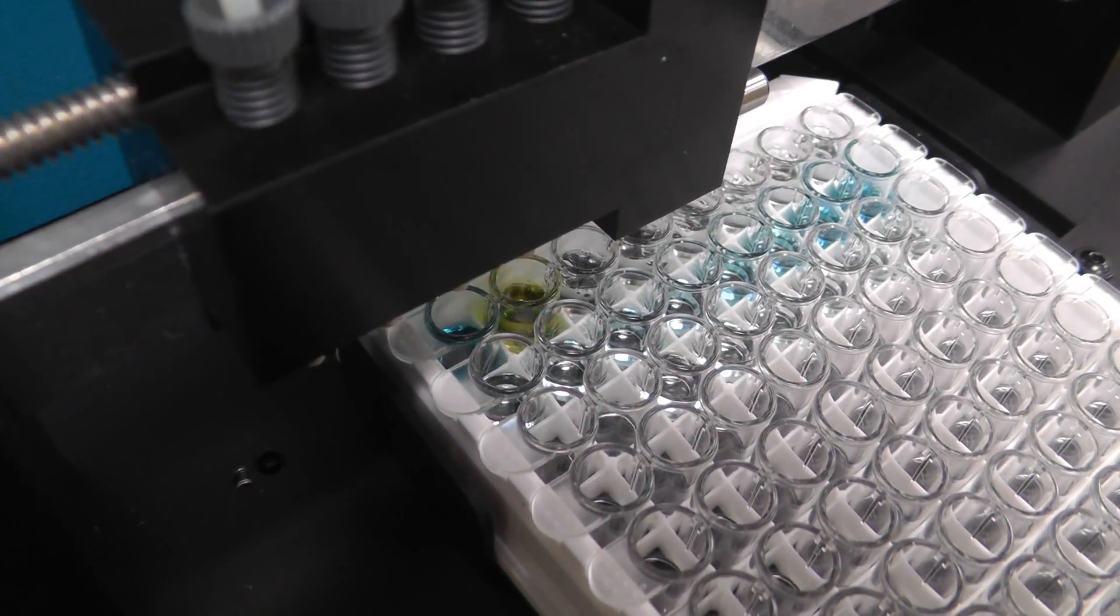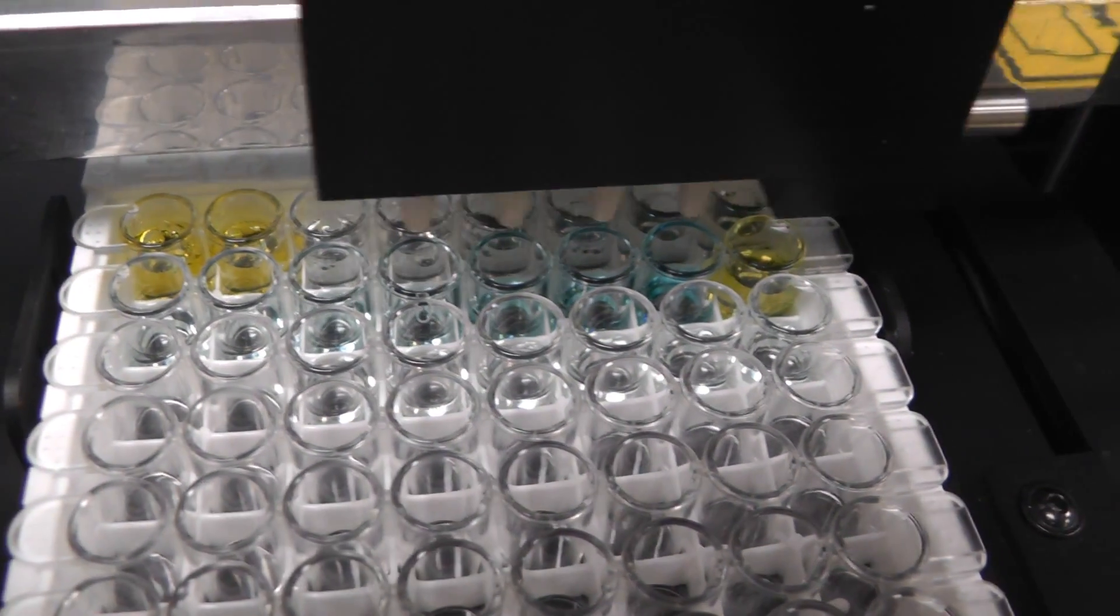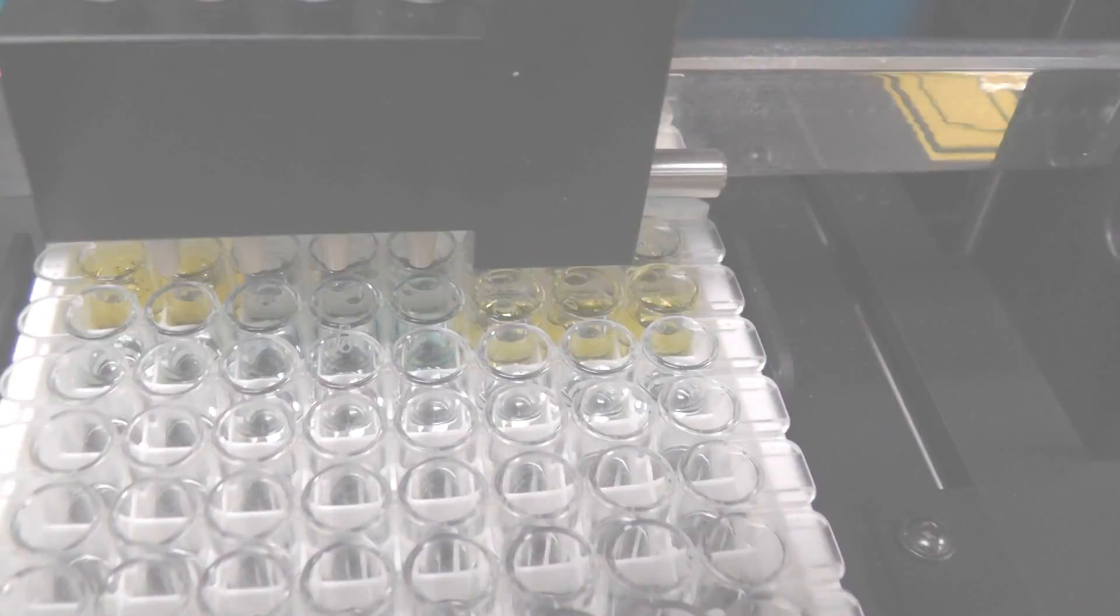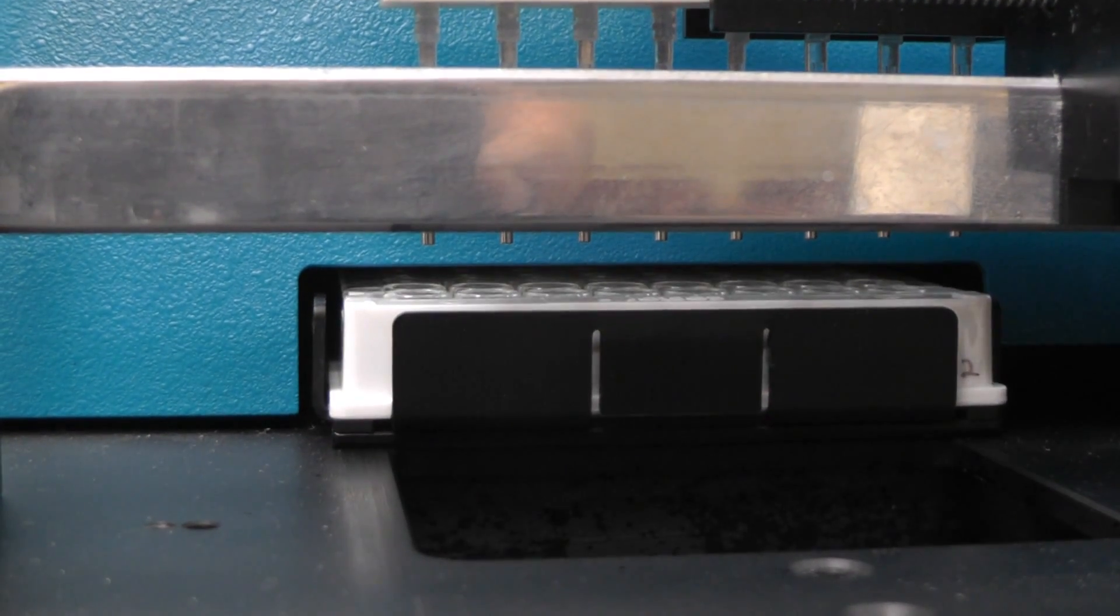We add 100 microliters of stop solution into each well. Now we read our microplate at 450 nanometer wavelength.